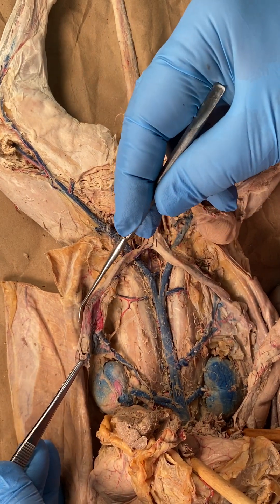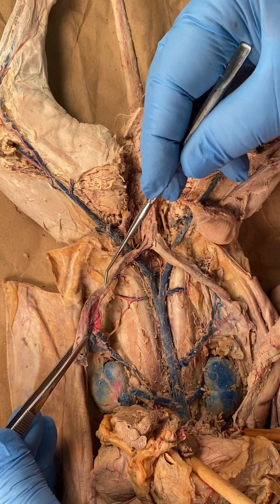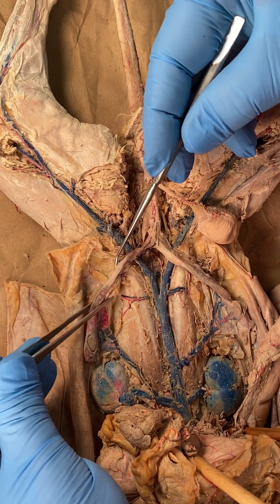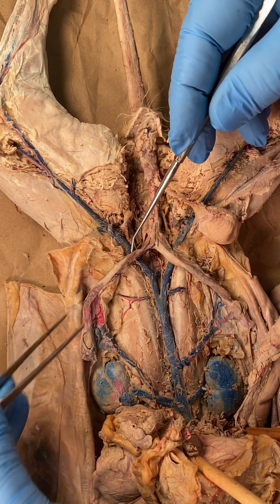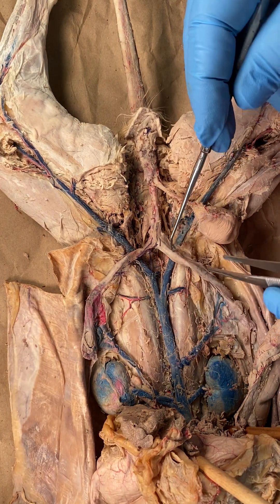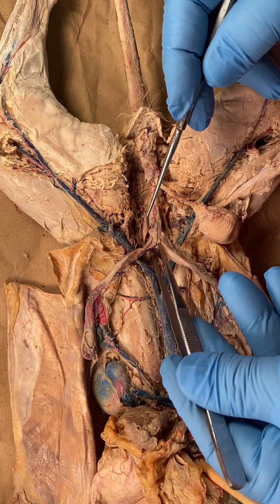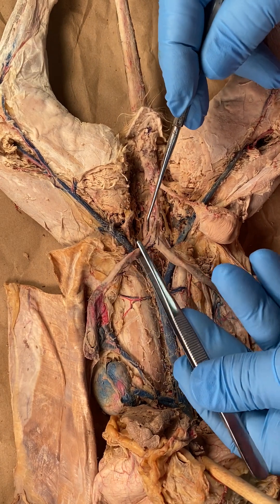The major channel or tube that goes to that — the left uterine horn on this side, and on this side, the right uterine horn. The uterine horn leads to the next major structure, which is the uterine body.